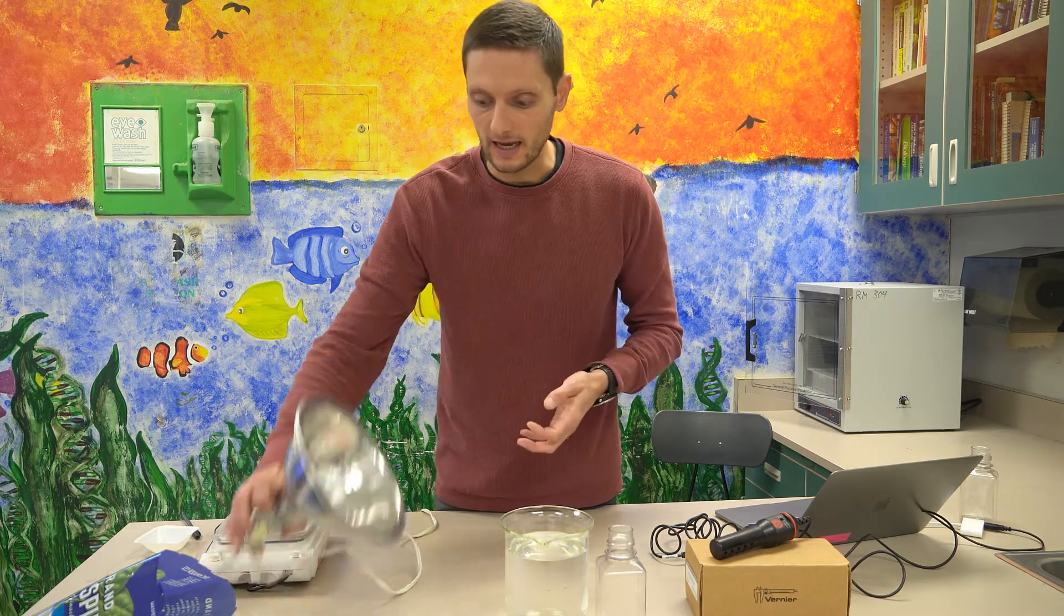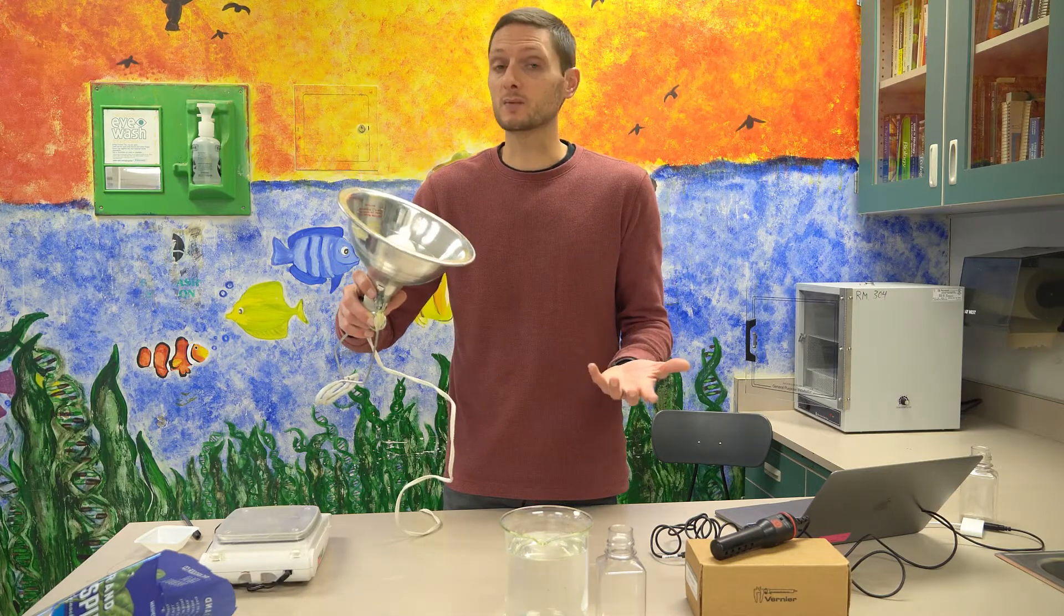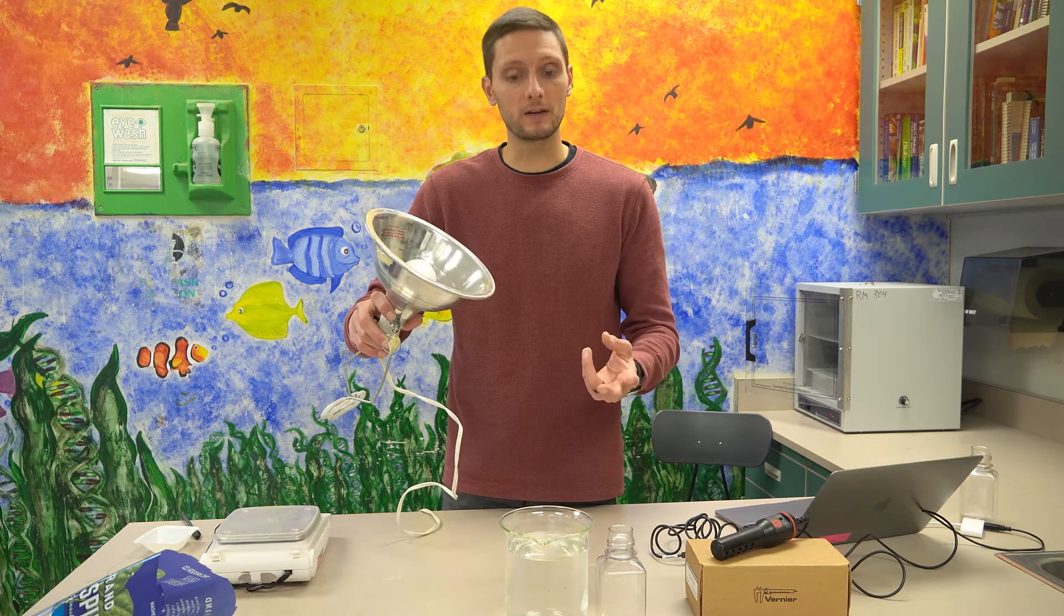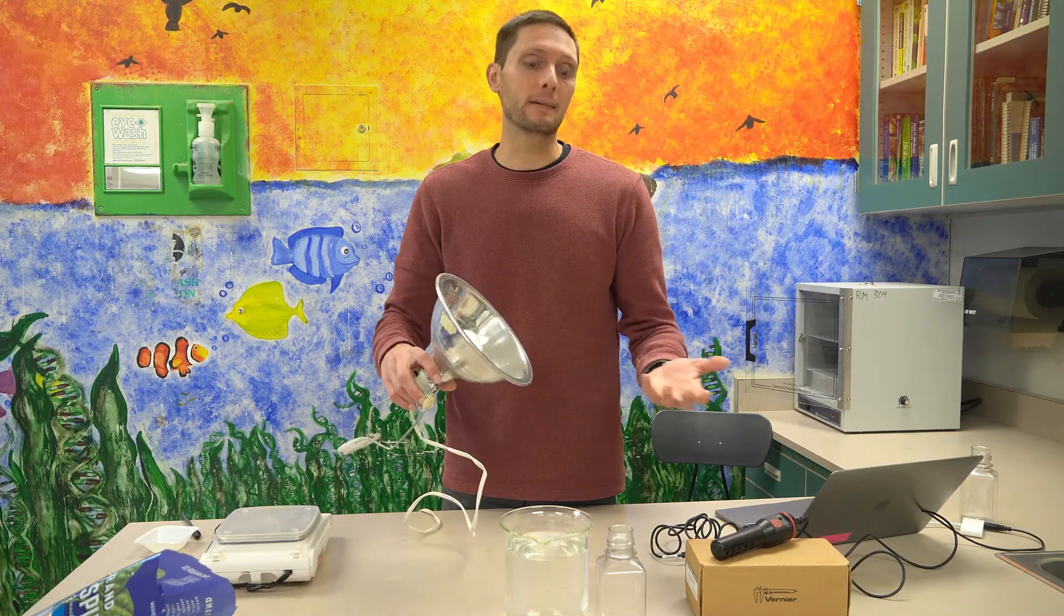A few of the other items that I have today that we're going to use is a 75-watt light bulb. Photosynthesis requires light and so we're going to conduct two trials today, or two conditions I should say, one with light and one in the absence of light.